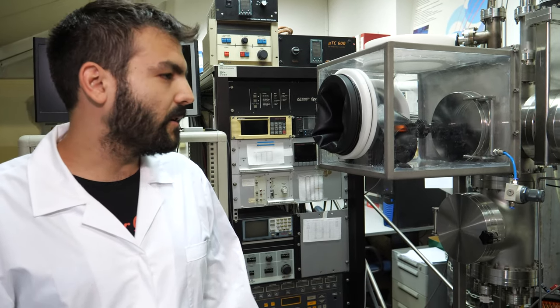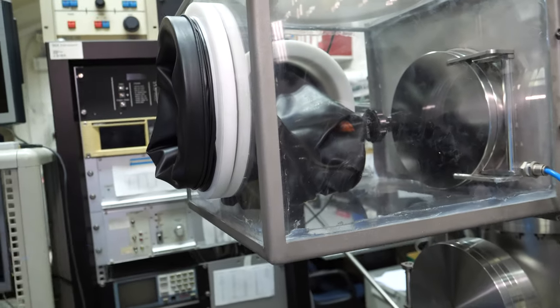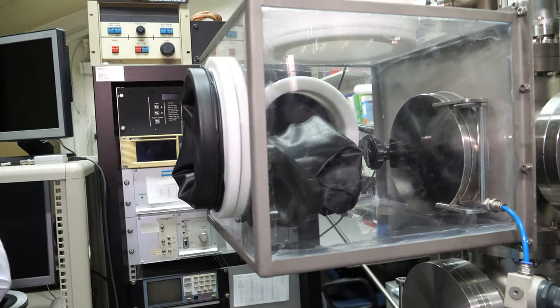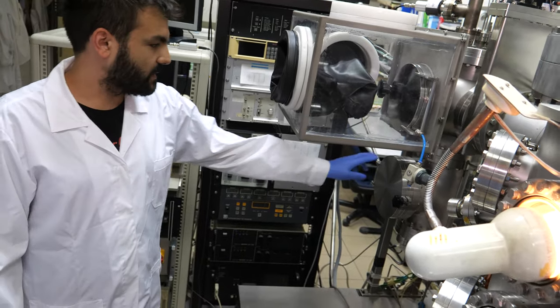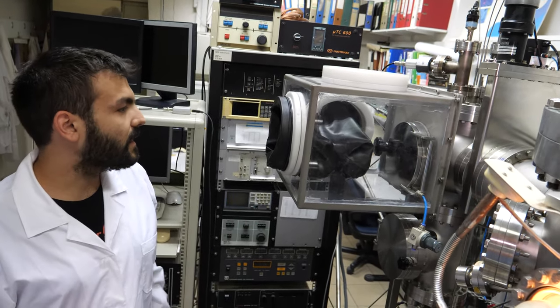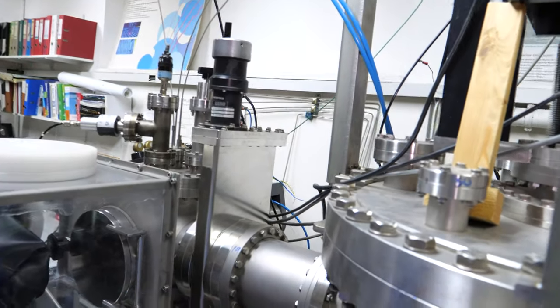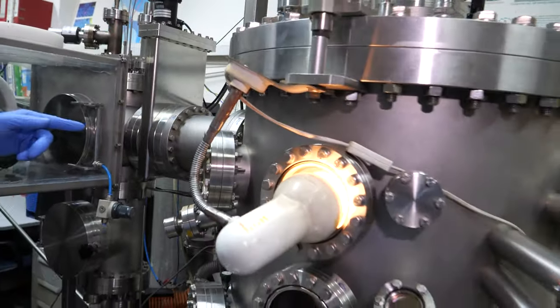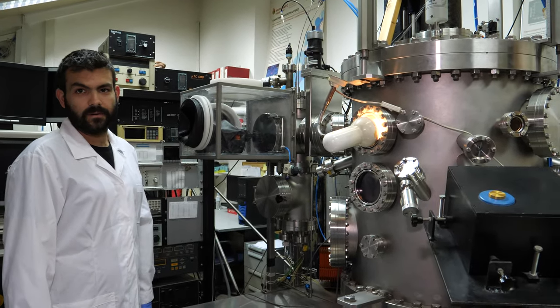In particular metallic pellets — gold pellets or silver pellets. Here we put the sample in this first chamber, then we open the gate that isolates the two chambers and pass the sample into the high vacuum chamber.